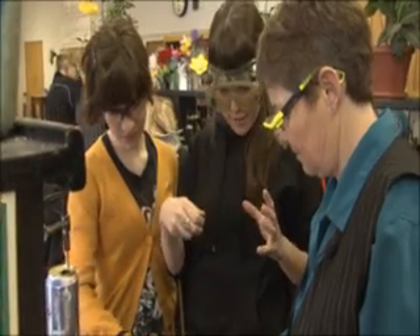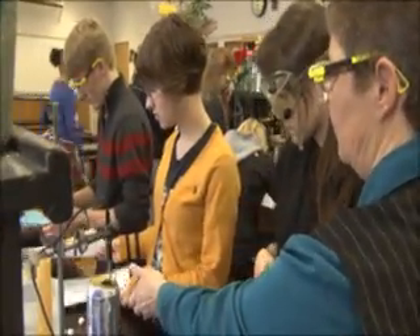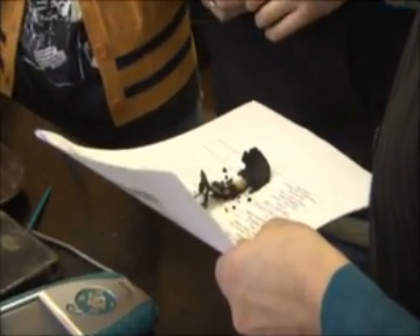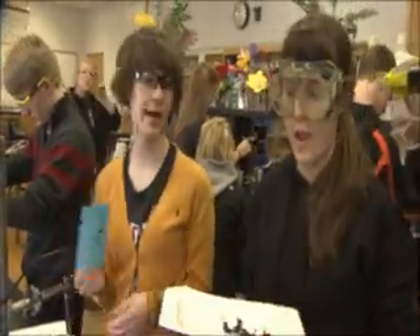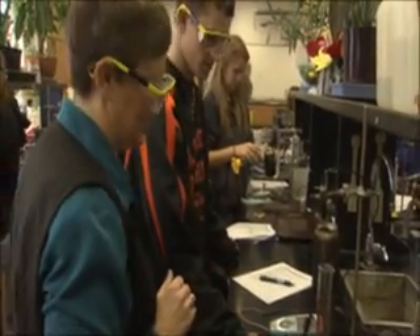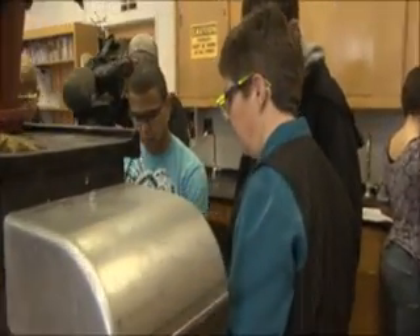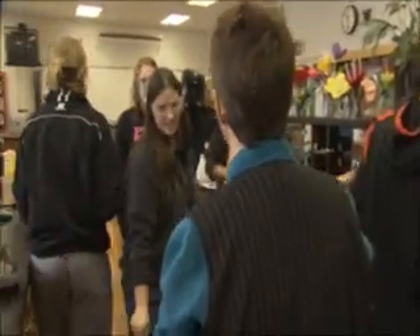Is it okay that we held it out here and it was flaming for a while? Like, it wasn't under here the whole time because it was too huge — it was going like this. It was out of control. Look at the temperature now — is it going up? One, two, three, four. No, I double-checked it too. Did it raise the temperature of the water? Yeah. Should I go weigh another normal Cheeto? Because maybe the initial weight was the thing that was the issue. Because that would not make sense. You're absolutely right.